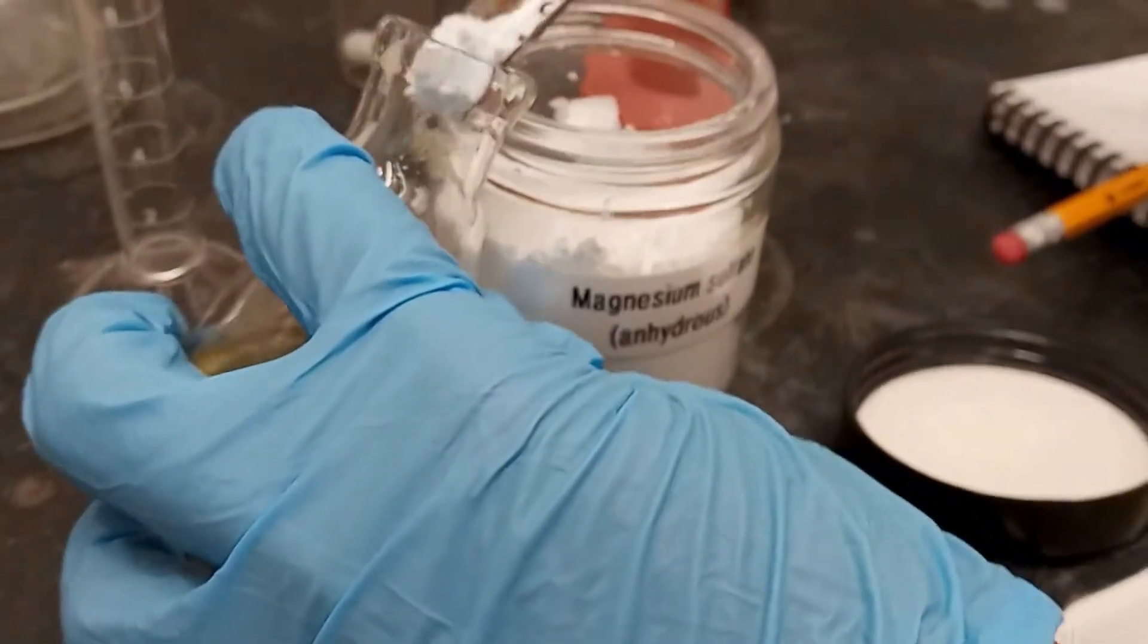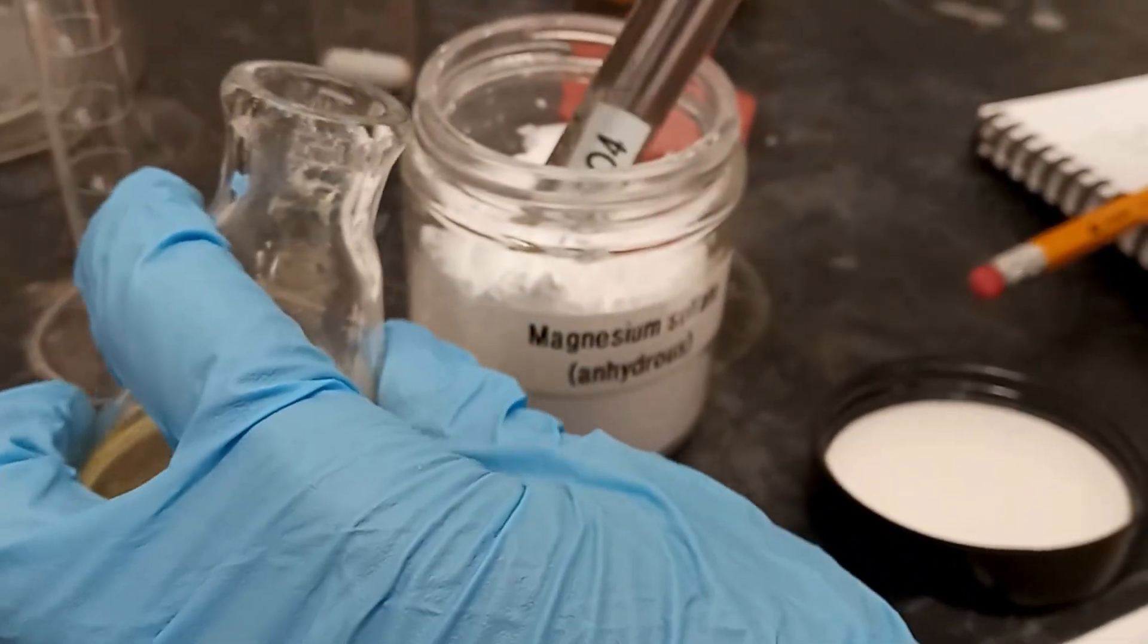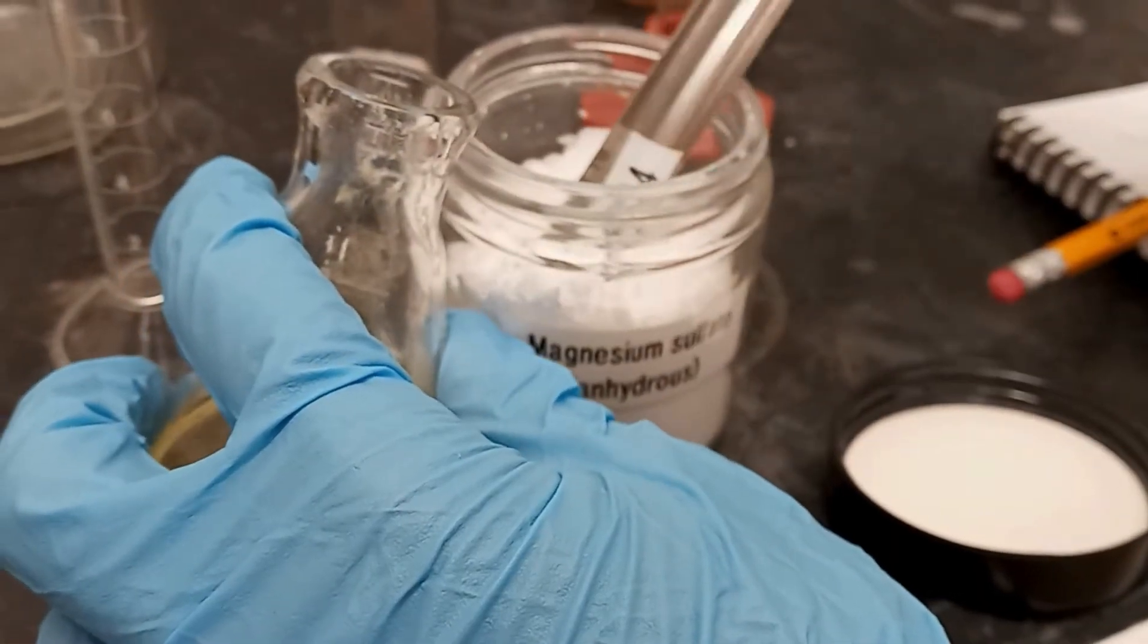We then added in several scoops of anhydrous magnesium sulfate and allowed the mixture to stand for 20 minutes.